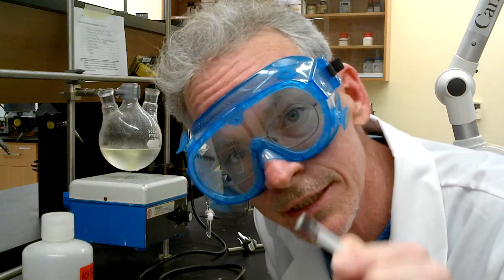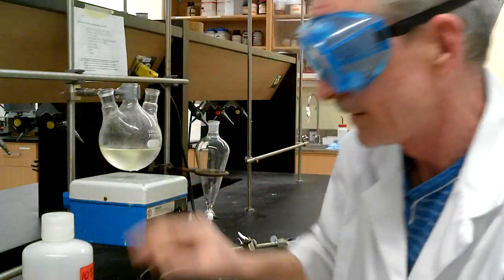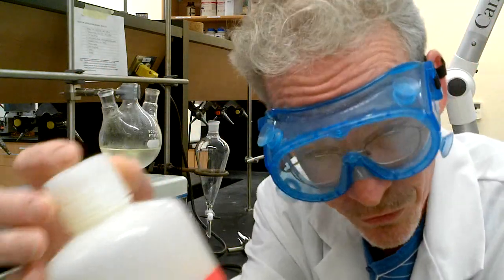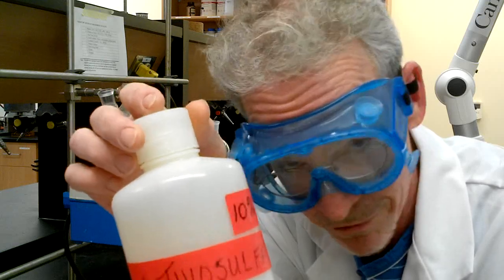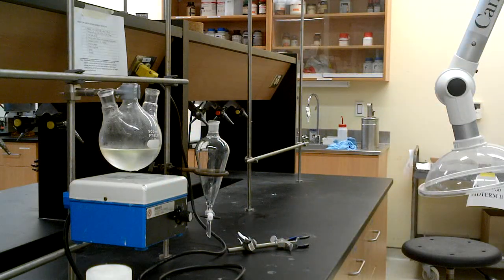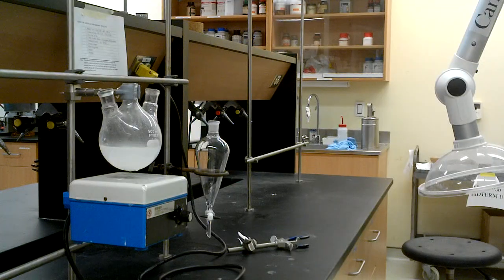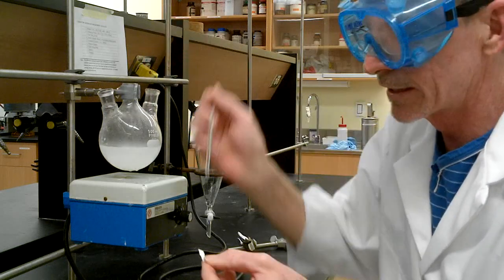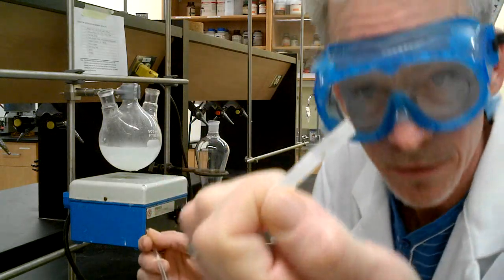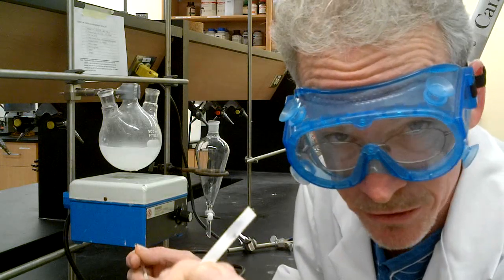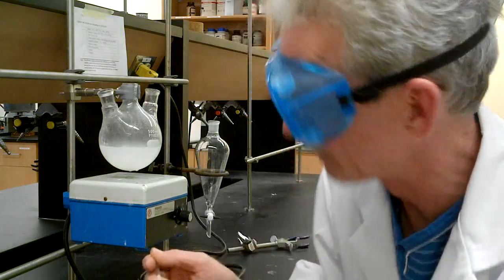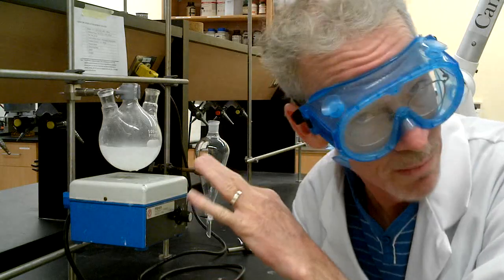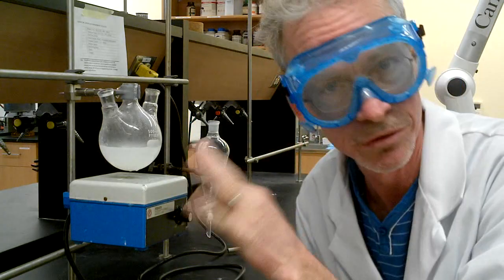So we're going to neutralize that with thiosulfate. You will find the sodium thiosulfate ready and waiting for you. Add a couple of mils and then test again. Okay, I had to add three or four milliliters. But I think I got it now. And you can see no reaction on the potassium iodide starch paper. So the bleach, the sodium hypochlorite, has been neutralized.